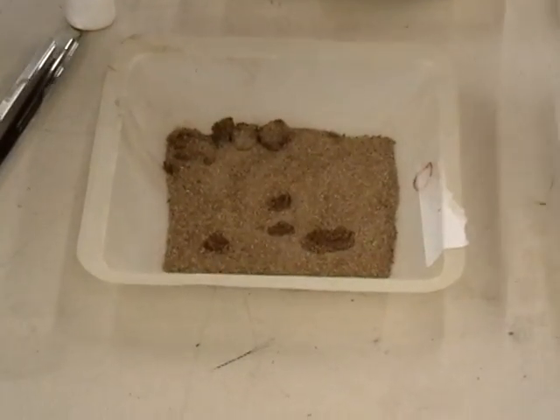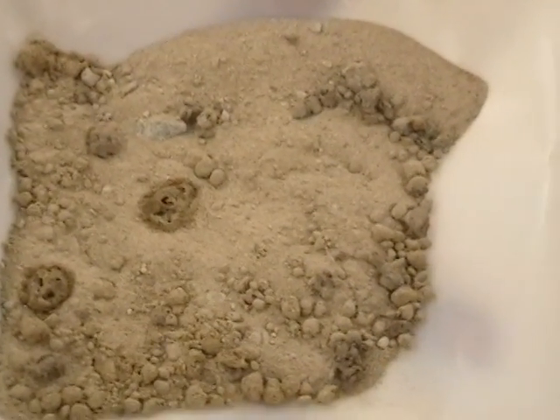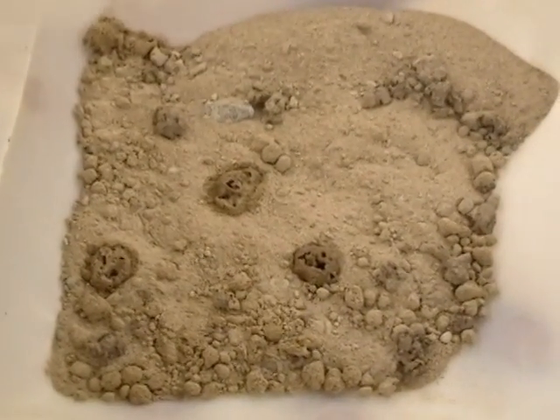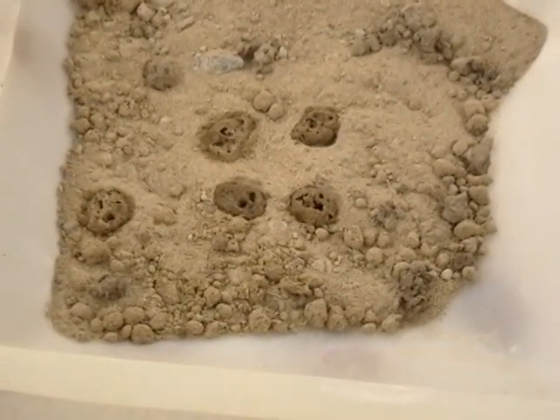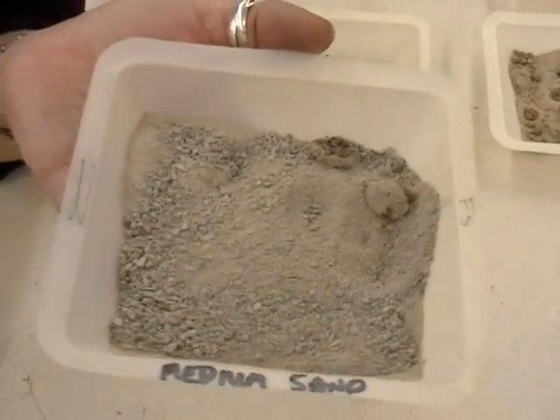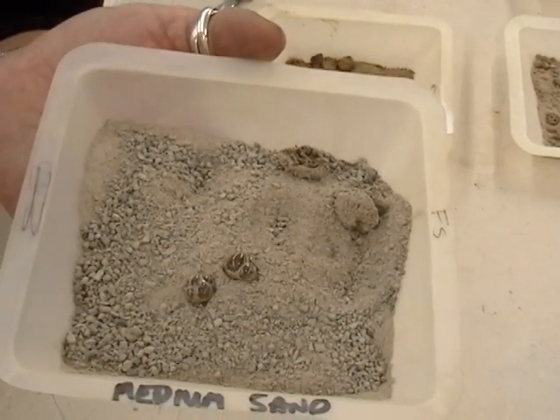As you work with your soil and gradually start to see the different soil types, you might see a different reaction in different soils. Here we can start to see a little bit more bubbling, and you will start to hear a little bit more of a hissing and crackling. So we are in the intermediate stages where we call something moderately calcareous, to a point where you might be looking at something in the range of strongly calcareous, where we're getting a lot more foaming occurring and a little thick foam.